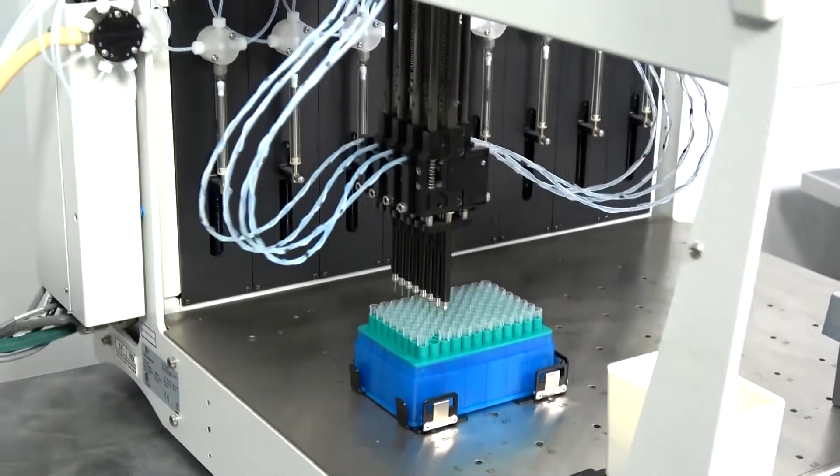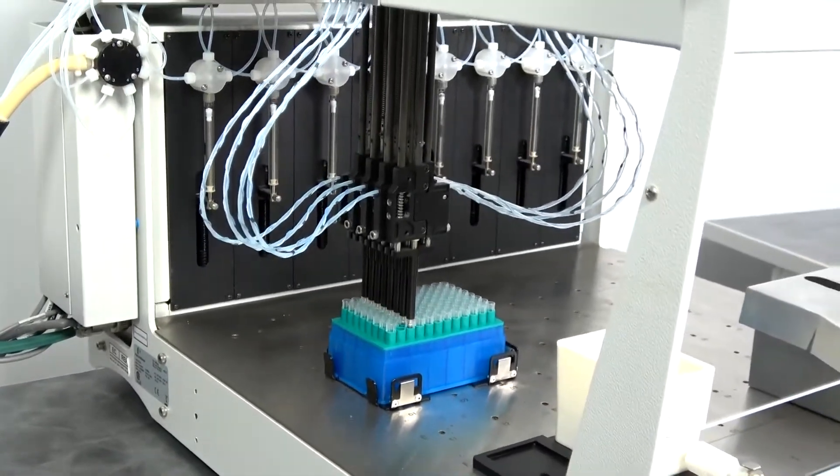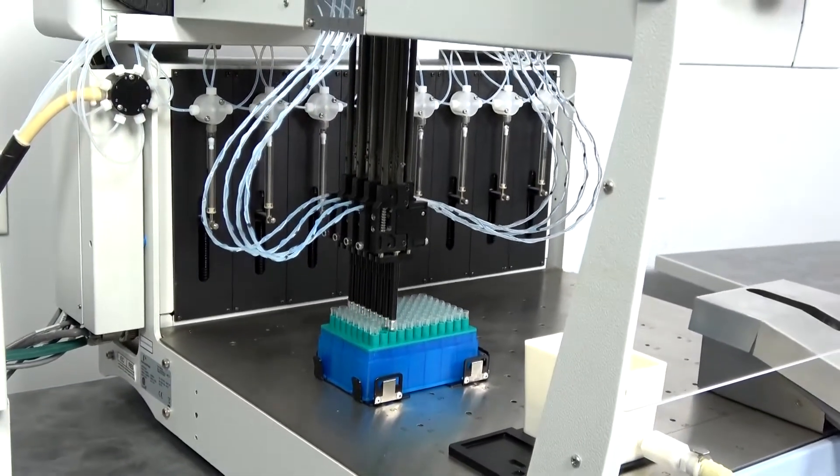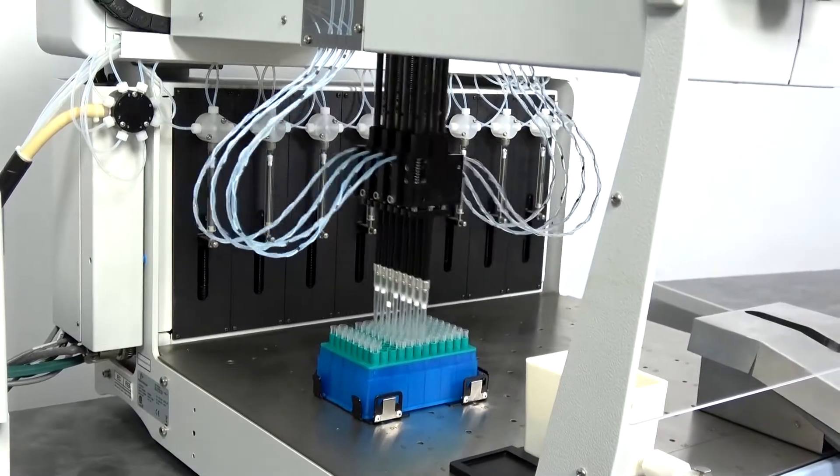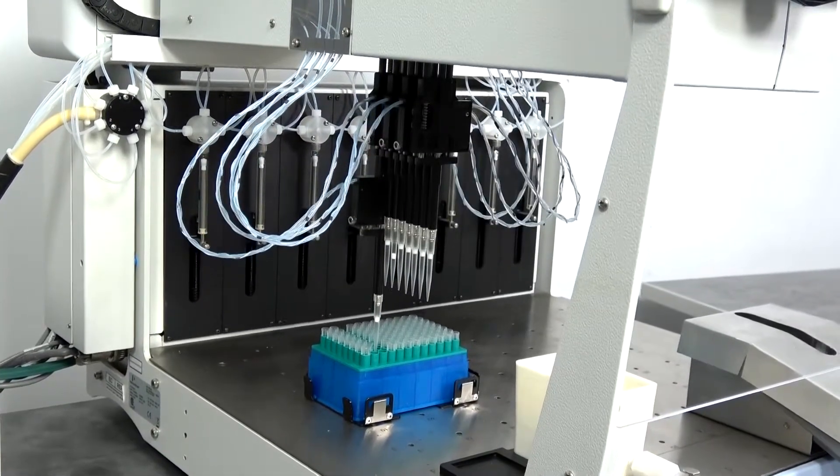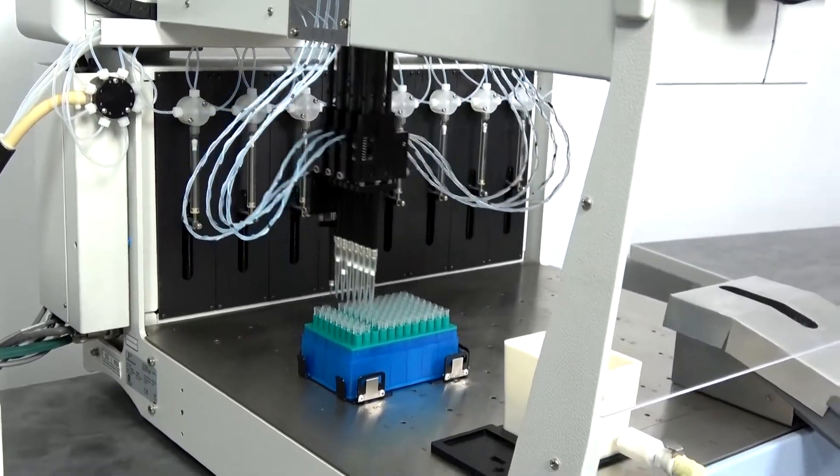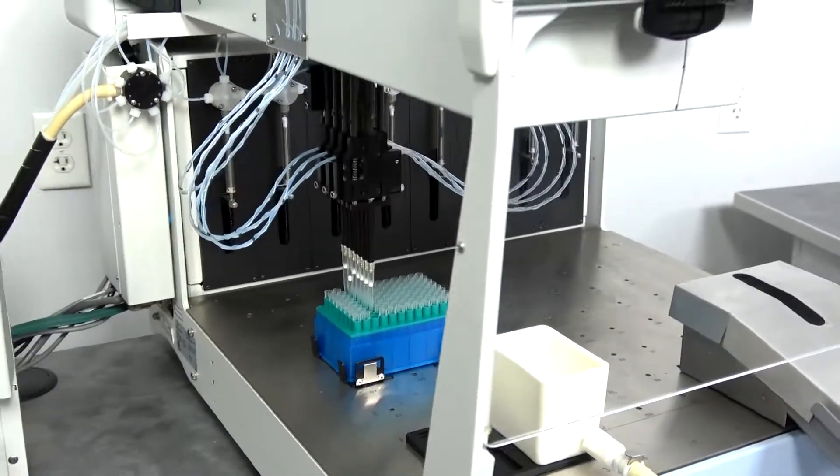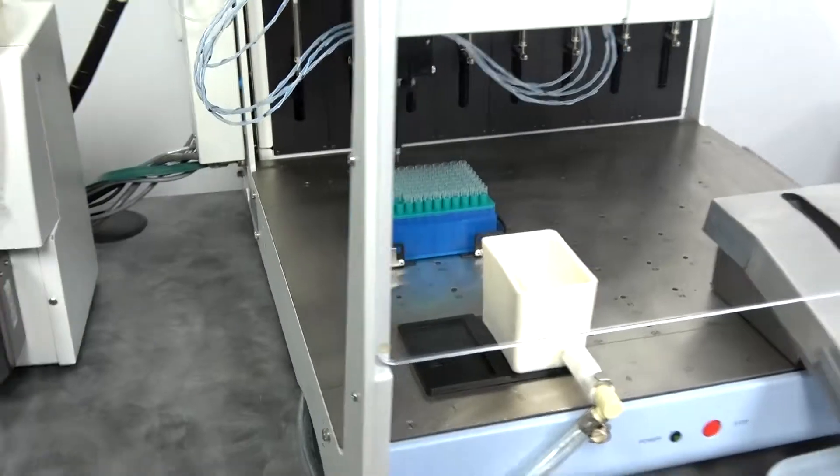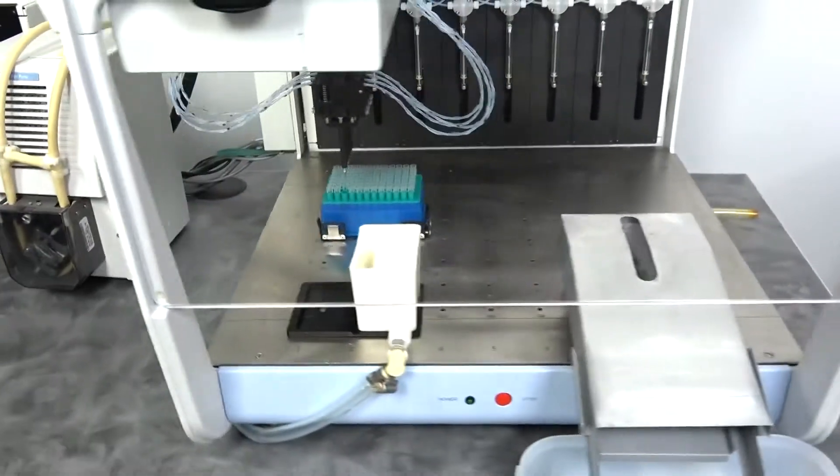This is just a little routine that I wrote just to move one tip around. It has no practical value, but it's kind of fun to watch.